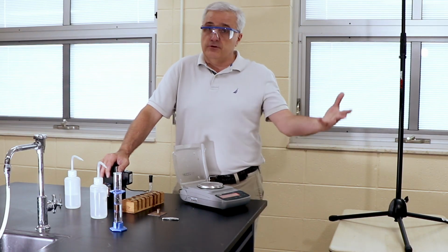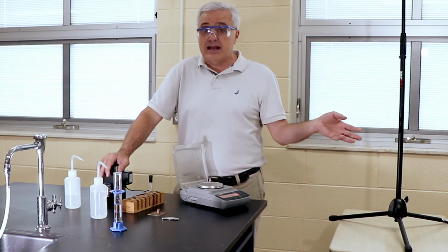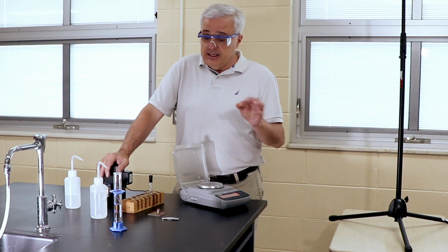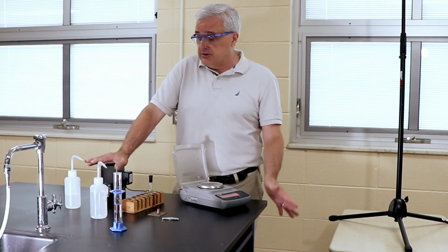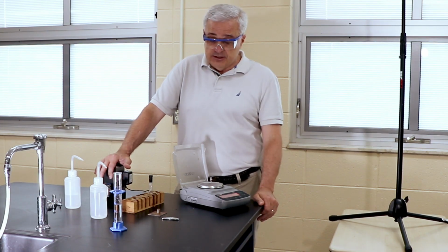There are more sophisticated lab tests where we could find out what it does react with and in what combinations, and go from there. But for an introductory lab on analytics, there it is. So there's the results.